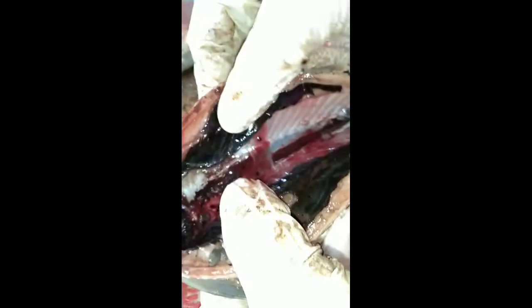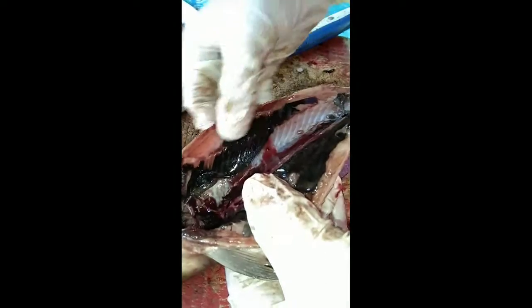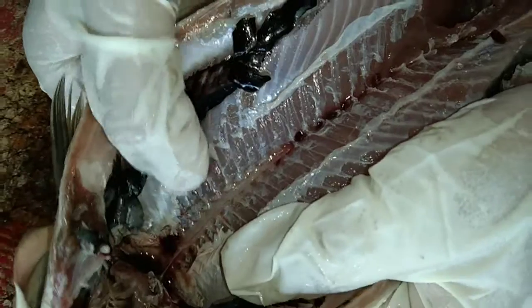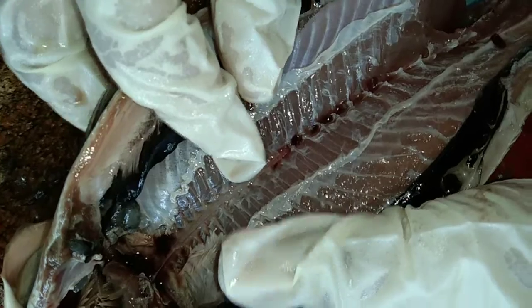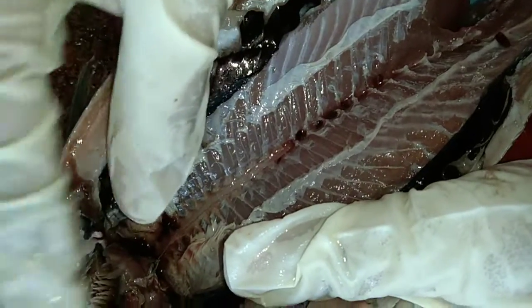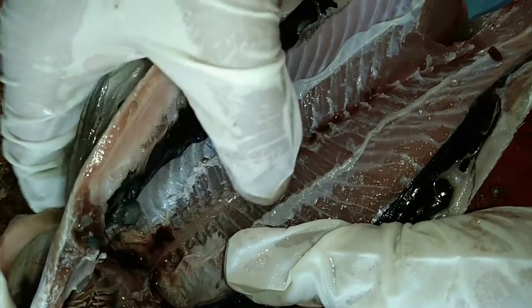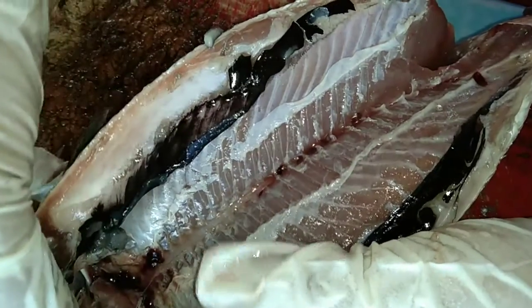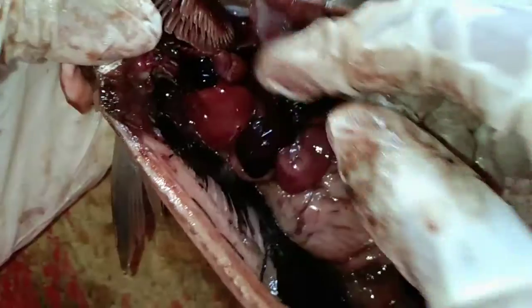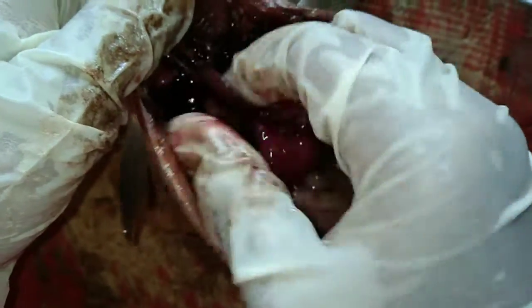Overall, the gills are the breathing apparatus of the fish — water is inhaled through the mouth, passed over the gills, and exhaled from beneath the operculum. The muscles serve as the meat of the fish, which is what humans eat. The spine is the primary structural framework upon which the fish body is built, connecting to the skull at the front and to the tail. The spinal cord connects the brain to the rest of the body and relays sensory information from the body to the brain, as well as instructions from the brain to the rest of the body.